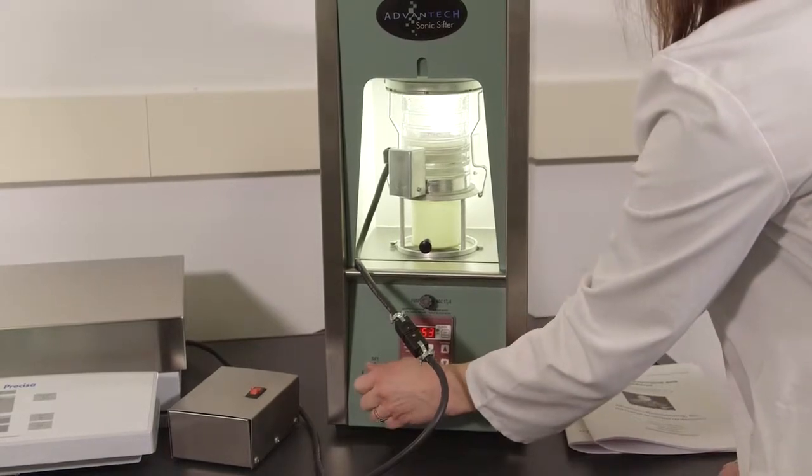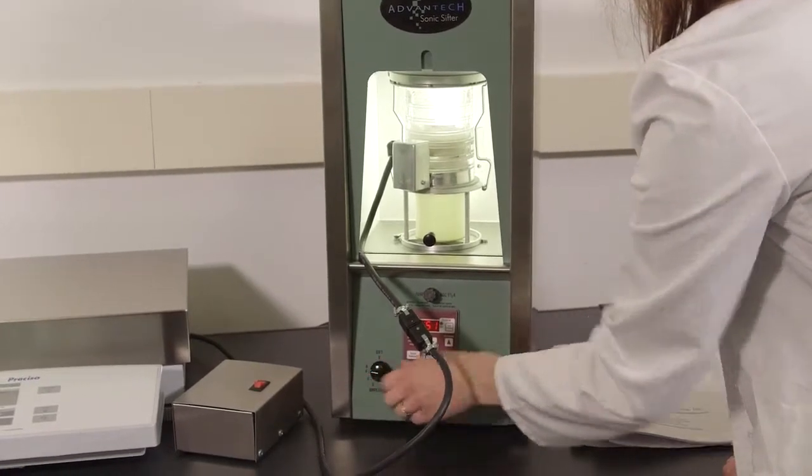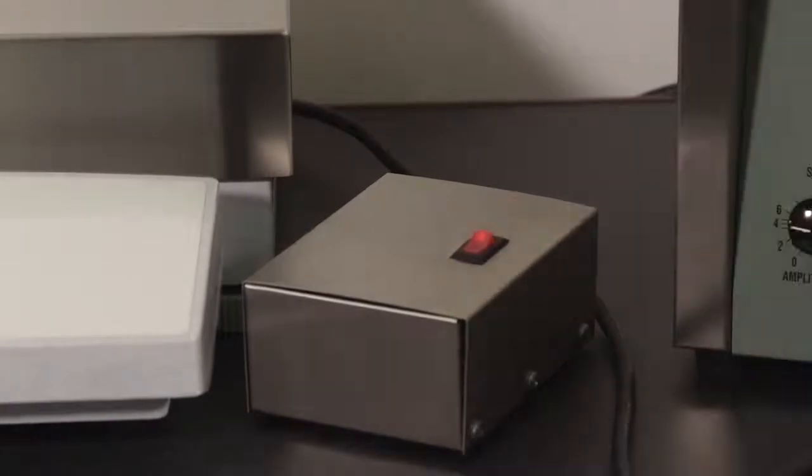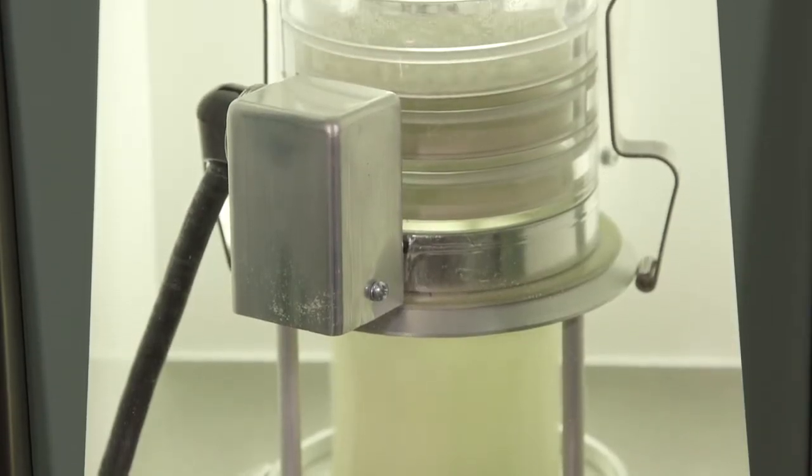If the sonic sifter will be in sift pulse mode, activate the horizontal pulse accessory so the pulses are opposite those of the L3P itself.